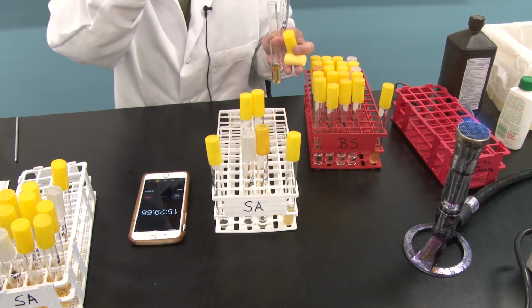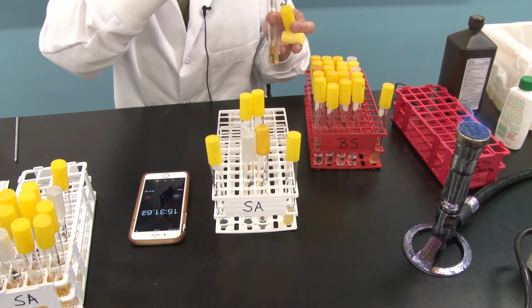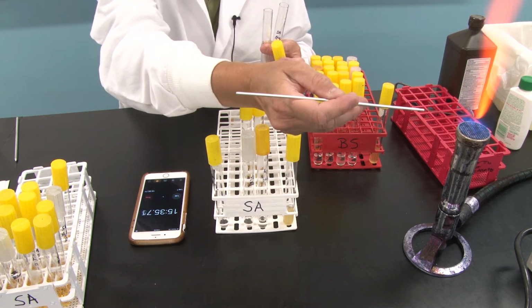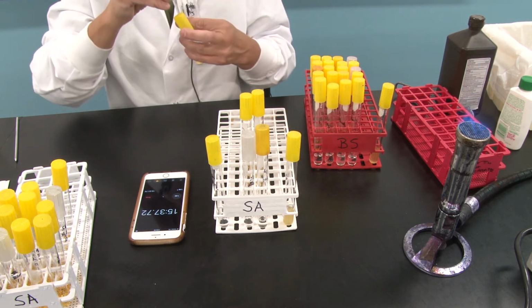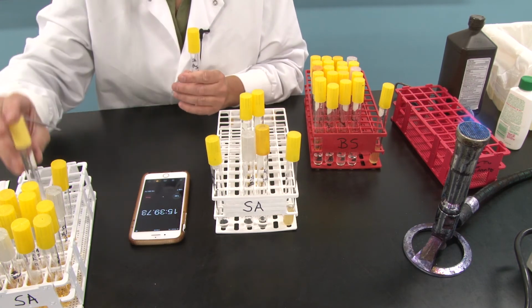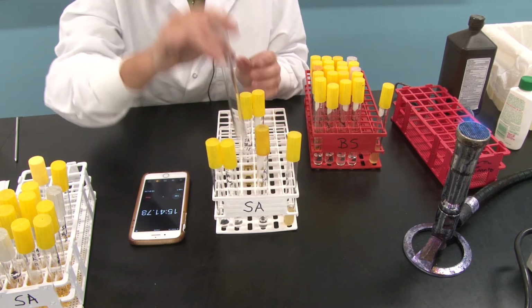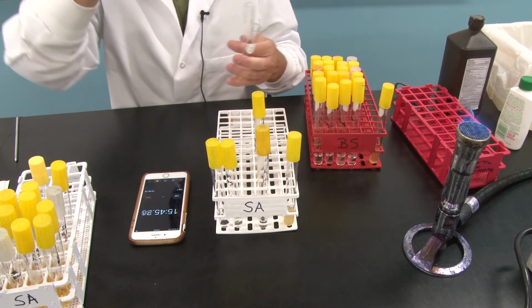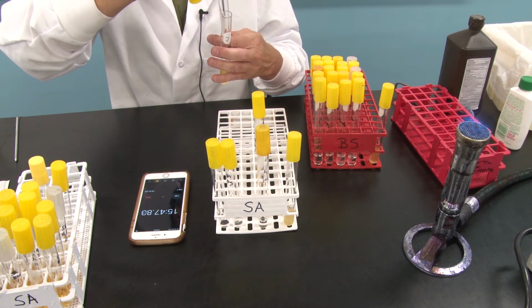Recall now that Staph aureus has sat in that hand sanitizer for a total of 15 minutes. We'll see if that was enough to kill it. Put that back, grab the bleach, and transfer the bleach.